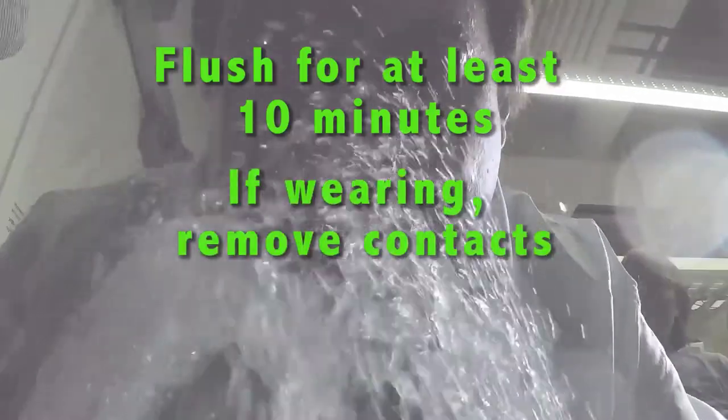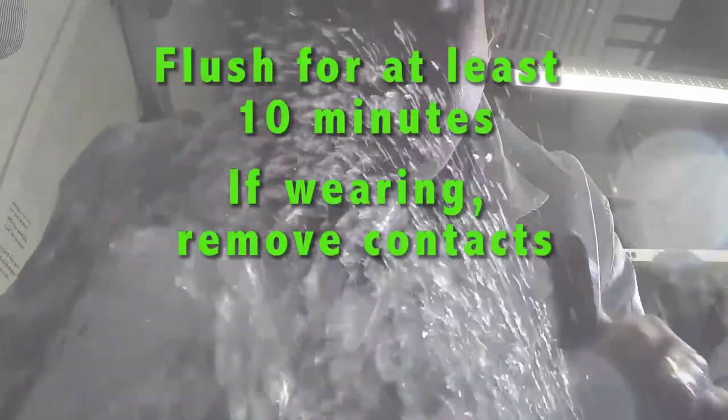Matt demonstrates the recommended technique for the eye wash. Prop your eyes open with your thumb and fingers. Flush with water for at least 10 minutes. Also, if you wear contact lenses, remove them while you are flushing. Contacts can hold damaging chemicals next to your eye.